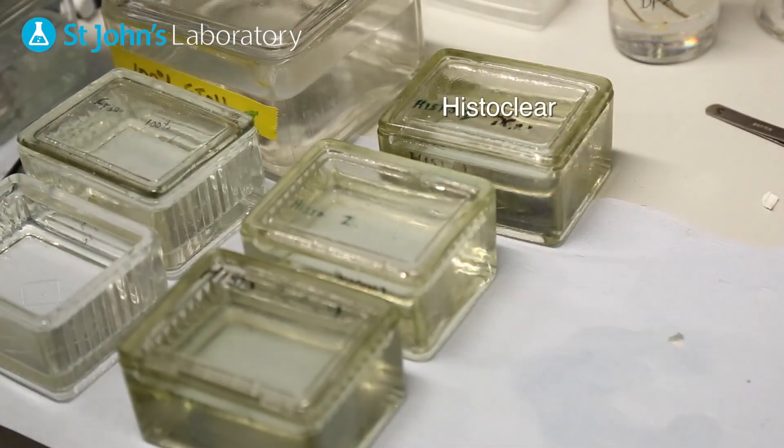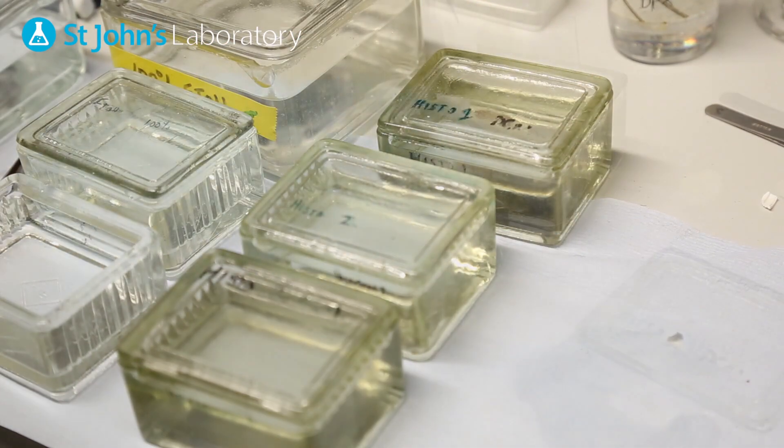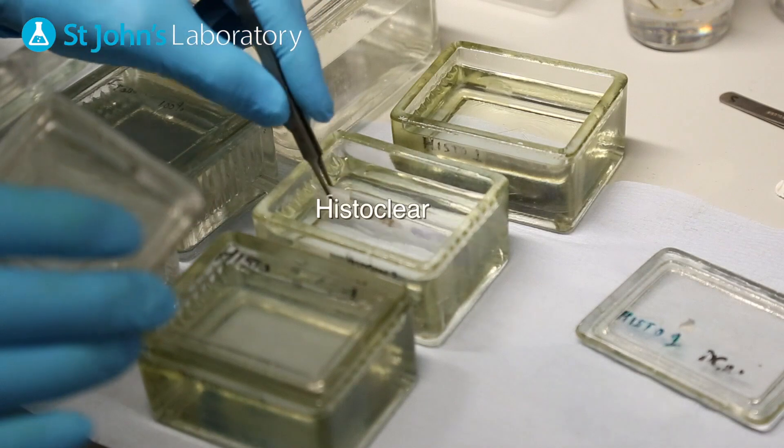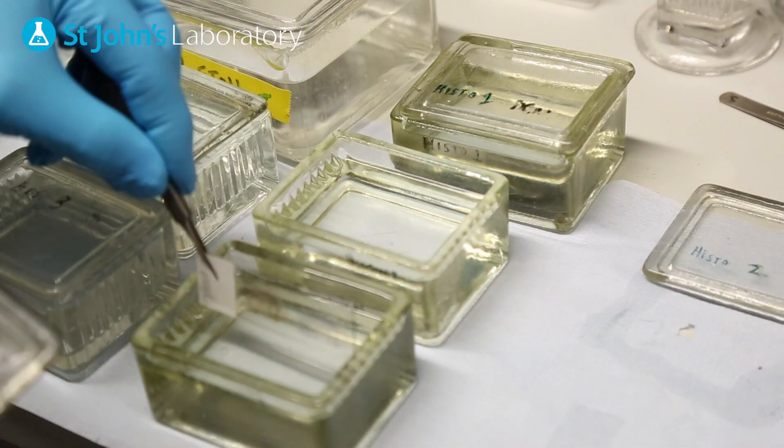HistoClear is then used to infiltrate the tissue so that it becomes translucent. Ensure that you allow incubation in three separate chambers for five minutes.